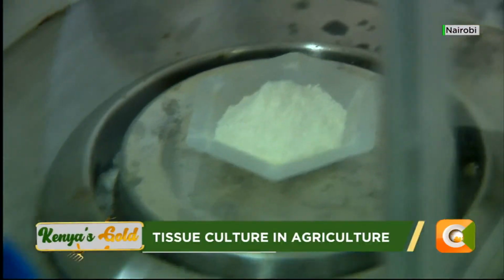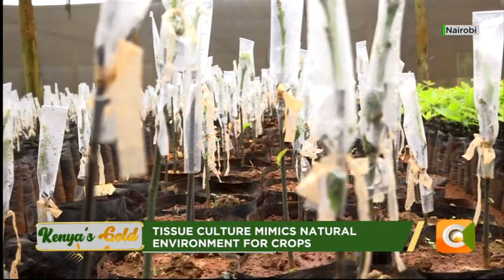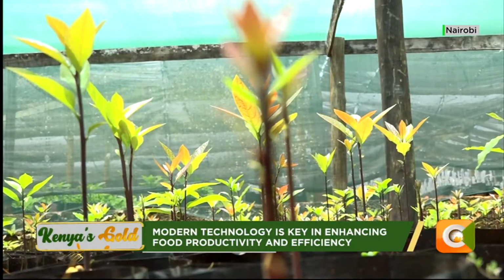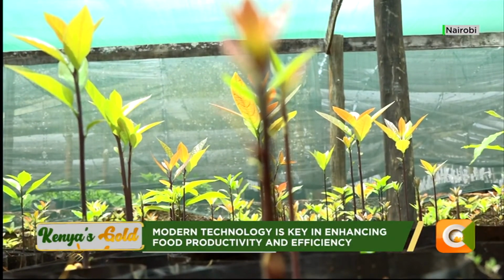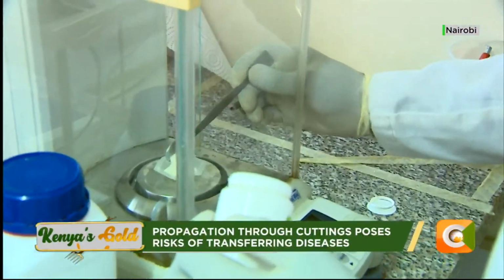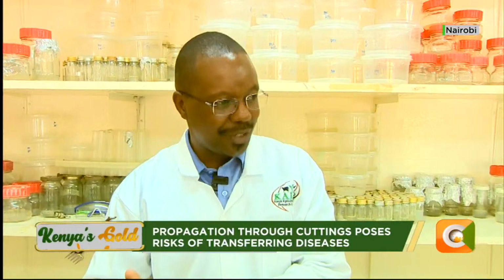Because in this technology, what you are targeting is more or less mimicking what happens in nature. When you have the cuttings, when you plant, it takes time to root and to start growing. So what we are doing is speeding that up by providing the nutrients at the lab level. Right. And that means you can put in the right nutrients, the right hormones.